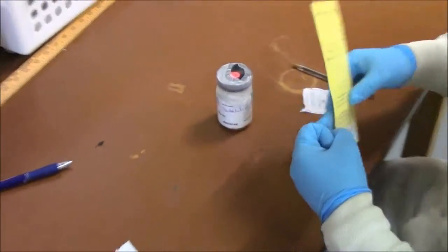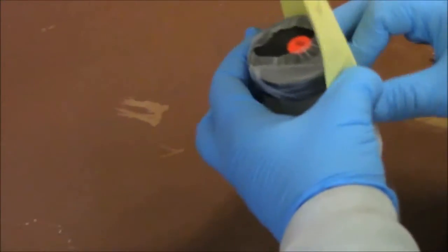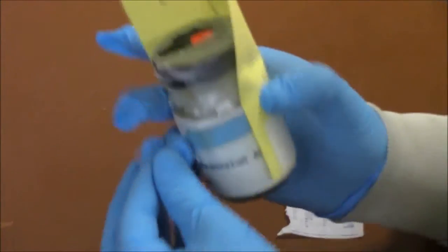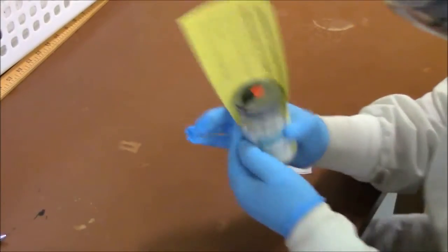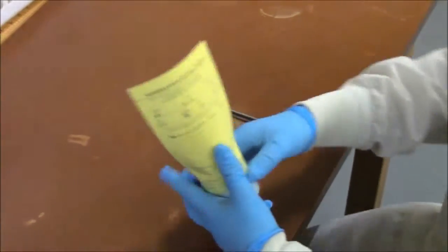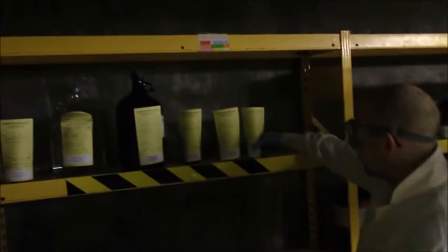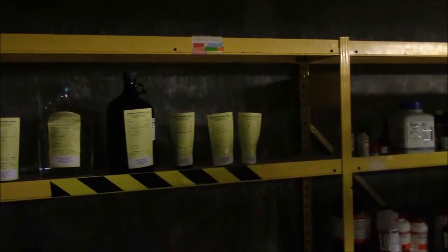After you get the waste card attached, you're now going to make sure you store it properly in one of the designated areas in the bunker. Make sure you store it in the bunker near only compatible chemicals. And that is how you waste a chemical.